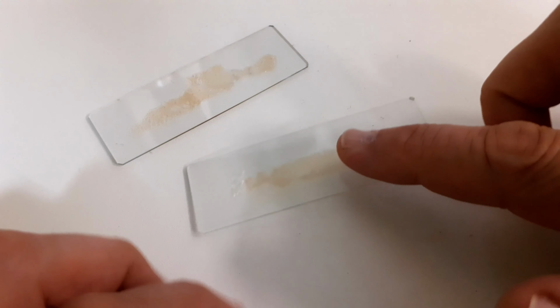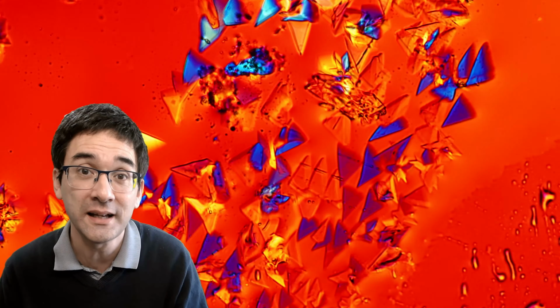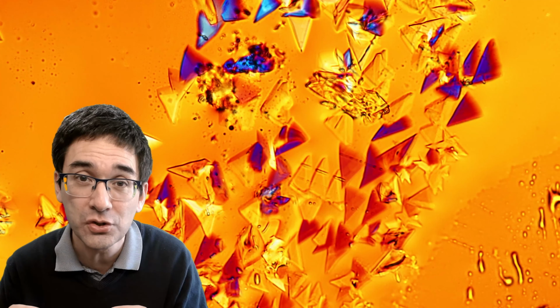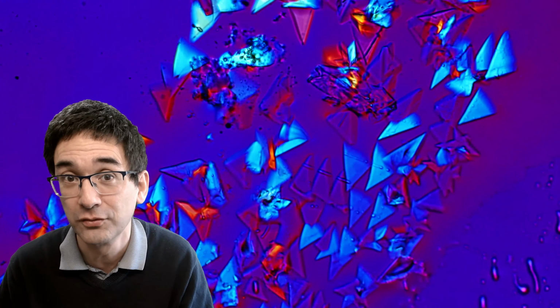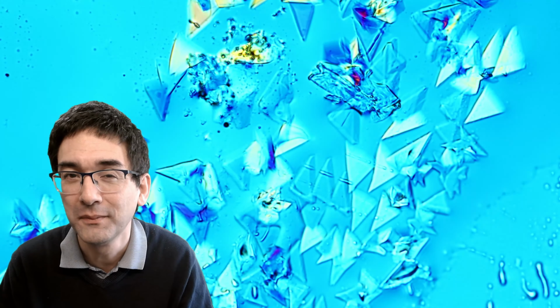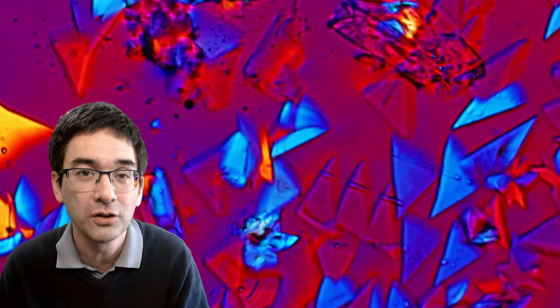The slide itself was very sticky, of course, as expected, but when I touched the slide and put the place under the microscope where I touched it, then all of a sudden I saw some crystals forming. Now that's an interesting thing. The crystals did not form on their own, but in those places where I touched the slide, small crystals, and quite many of them, started to form.